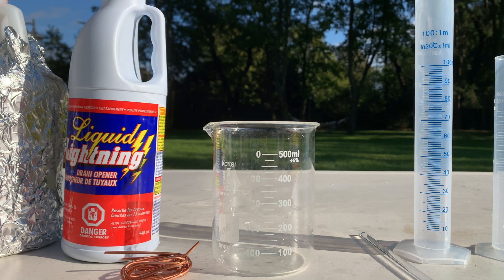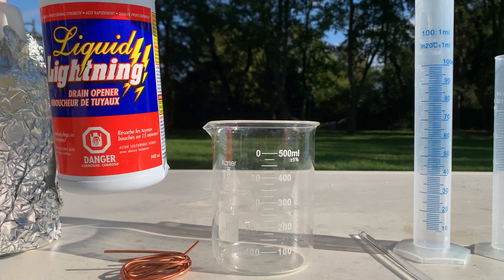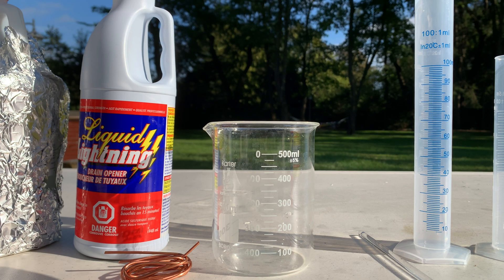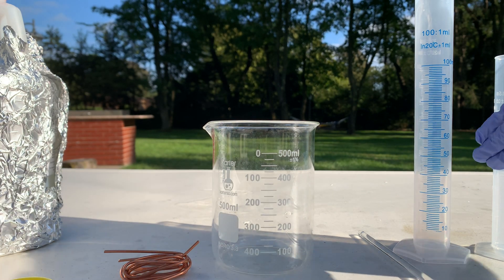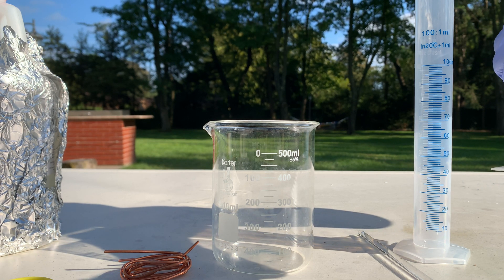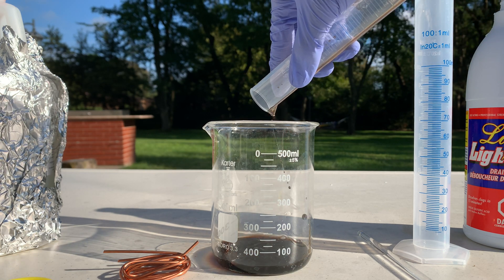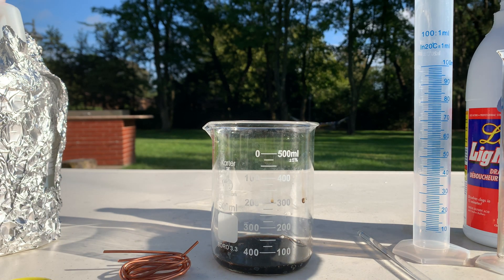I'm going to start by adding 30 milliliters of my sulfuric acid. I'm using this drain opener called Liquid Lightning, which is supposed to be around 96% sulfuric acid. It is kind of scaring me that it's a pretty dark color, but hopefully this doesn't get in the way of our synthesis.